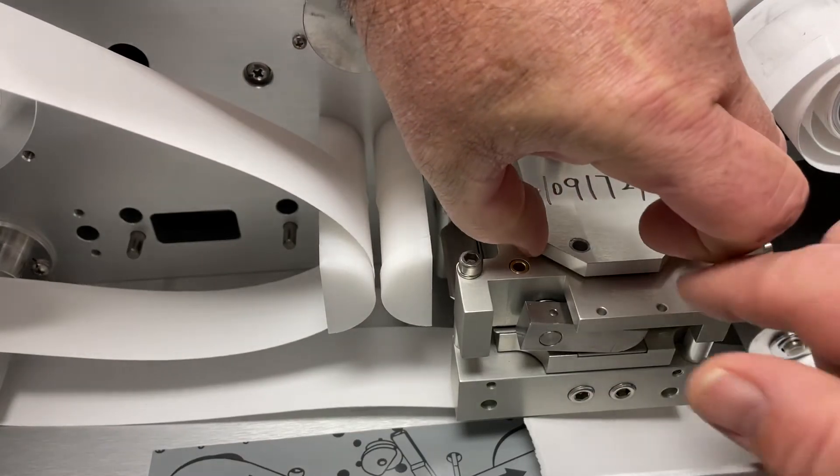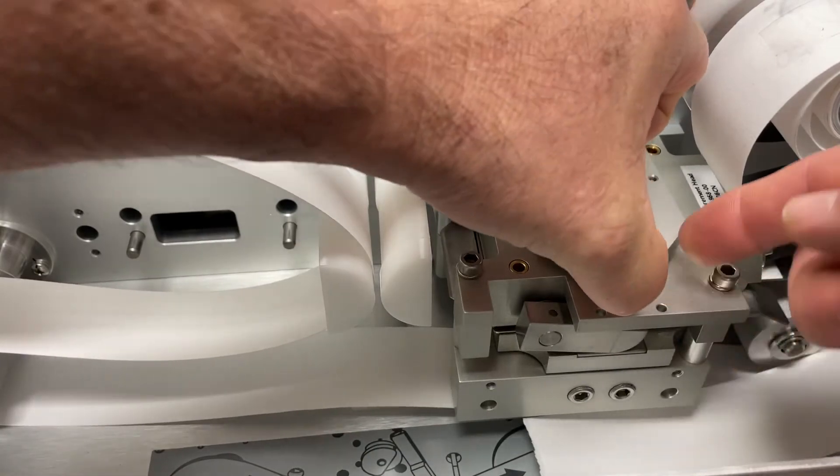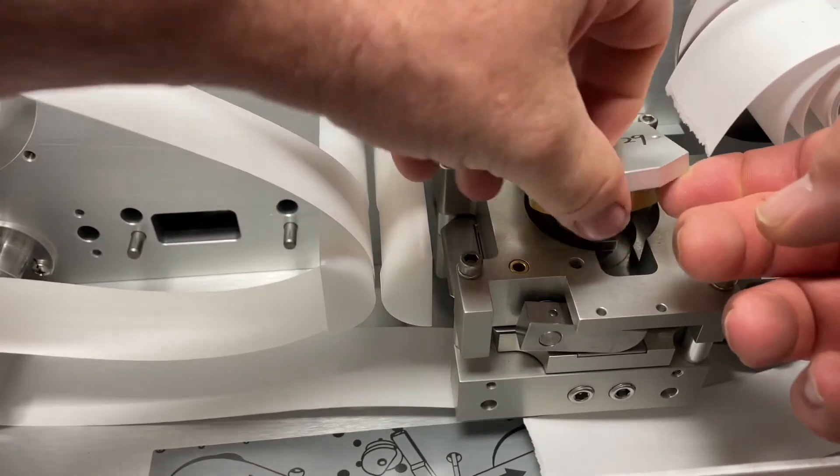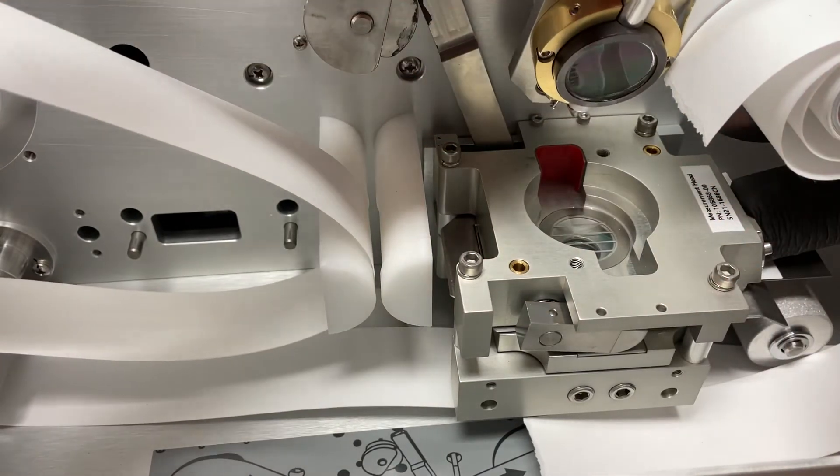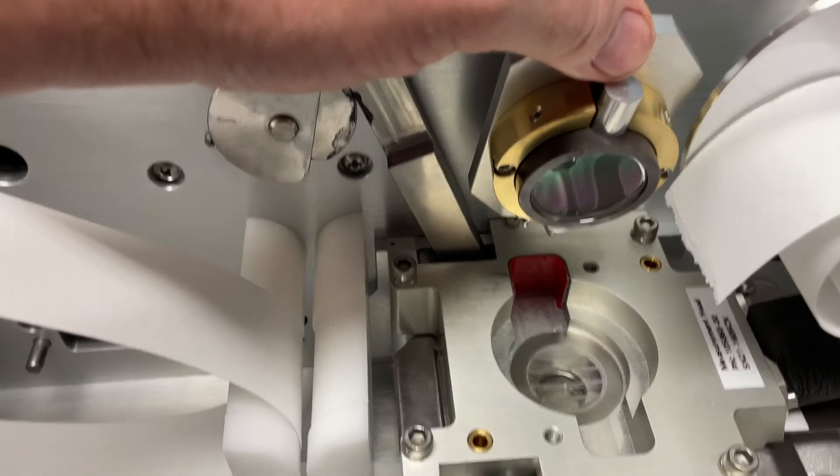Just to give you kind of a bird's eye view of what that looks like, this is not something you would normally do. I've taken the screws out of the detector just to lift it up and show you what this looks like underneath. Normally you wouldn't be going in here.